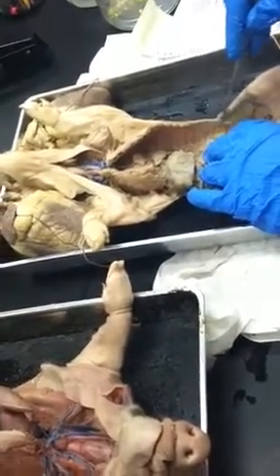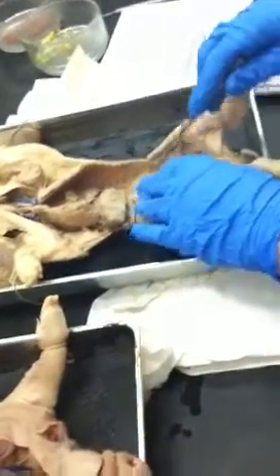So the adrenolumbar, just pick up the kidney. Pick up the kidney. Going off. You head down the track, you're still in the aorta, and now some of these have split off. One, you can see the posterior mesenteric going up the large intestine. This one right here.